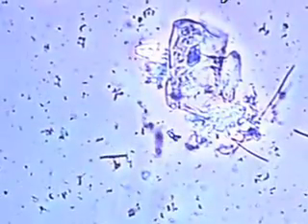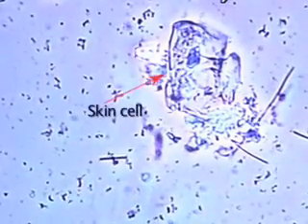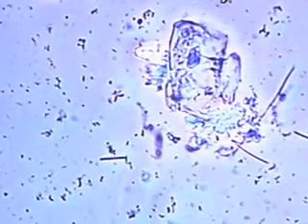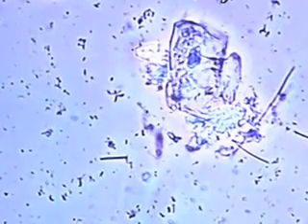Are those things that look like hair bacteria? Yes, these are long thin rods — bacilli — and we just say they're long thin bacteria.